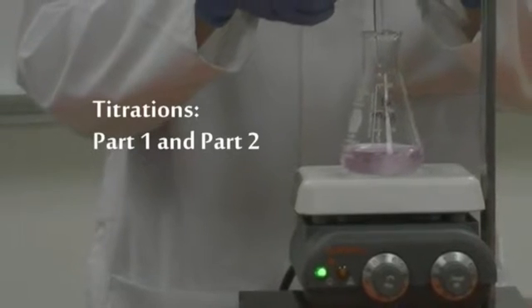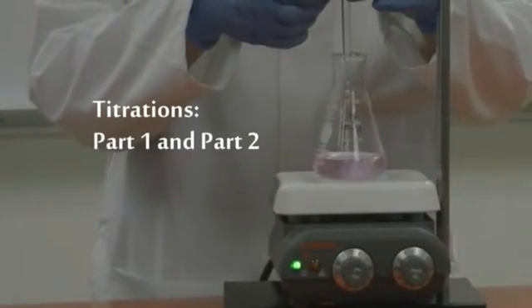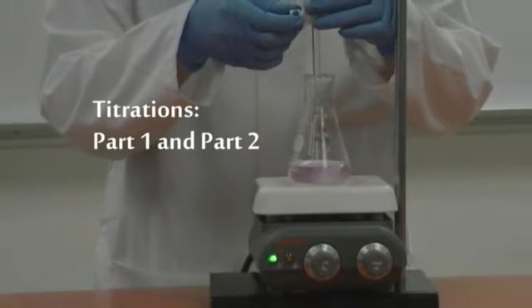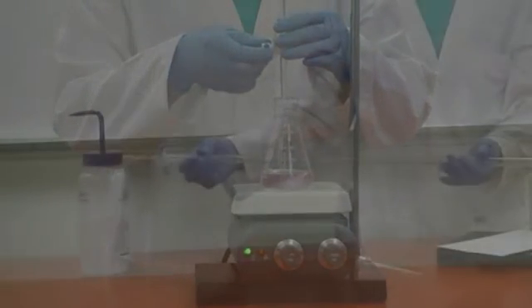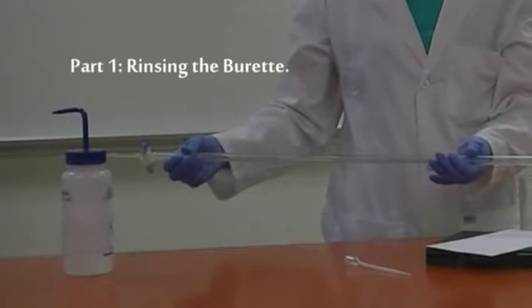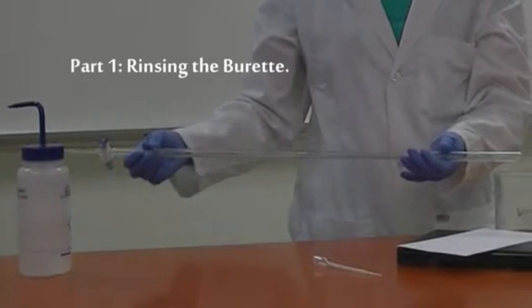We will now demonstrate the proper technique for titrations. First, we will show you how to rinse the burette correctly.